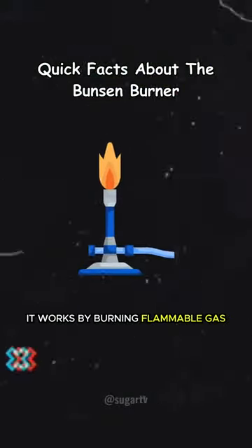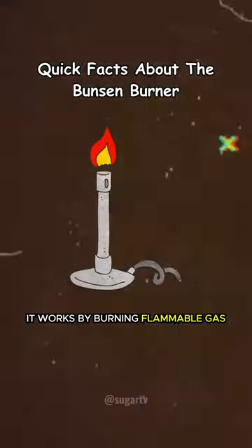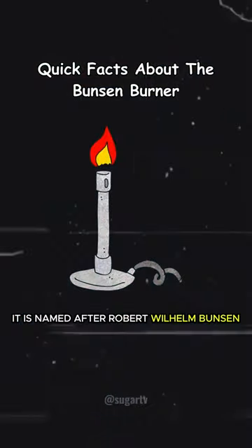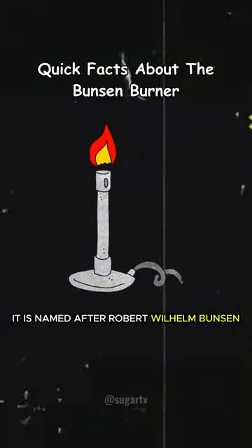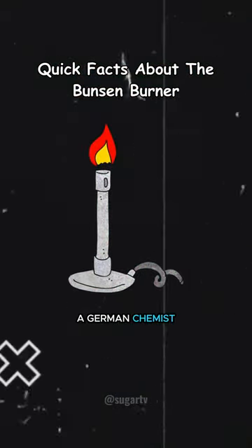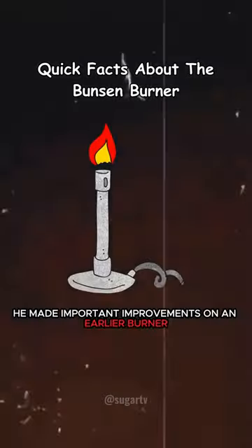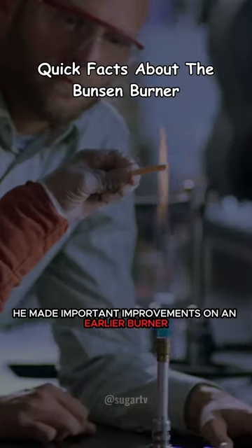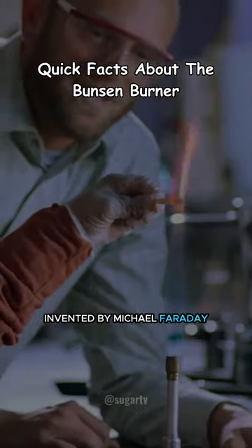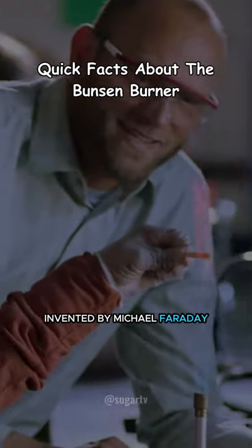It works by burning flammable gas. It is named after Robert Wilhelm Bunsen, a German chemist, who made important improvements on an earlier burner invented by Michael Faraday.